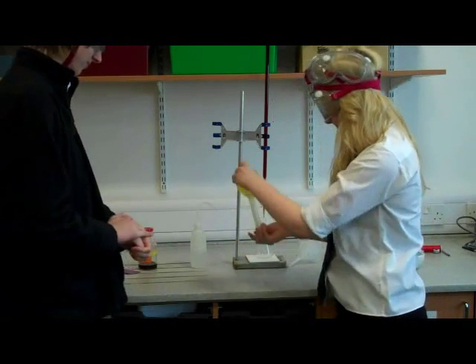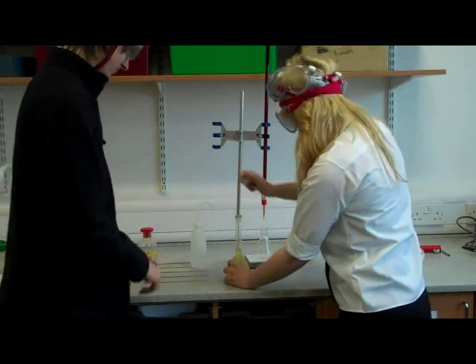Step 4. Prepare 25ml of solution into a conical flask.